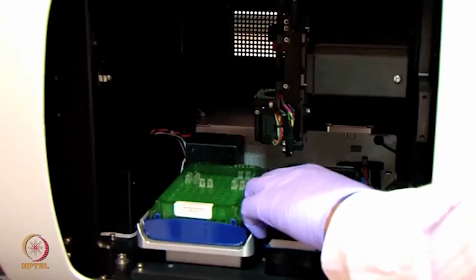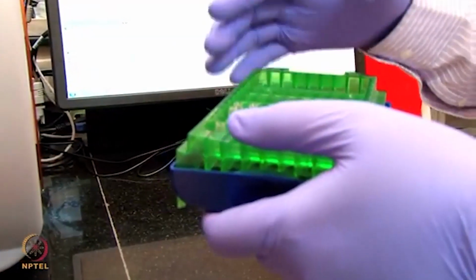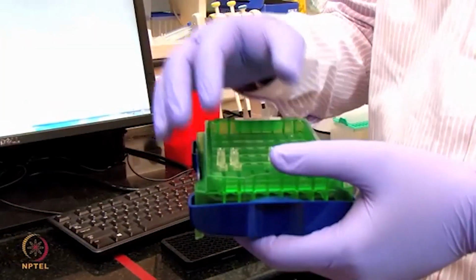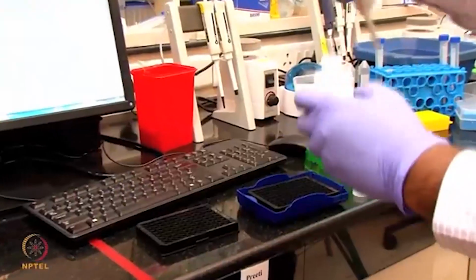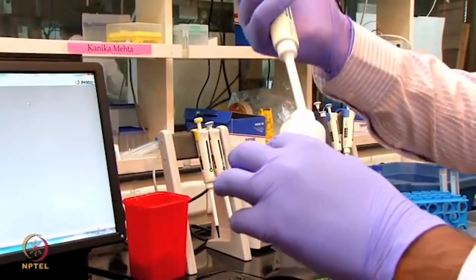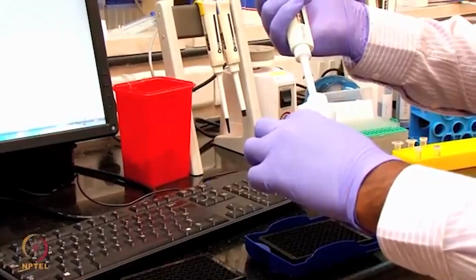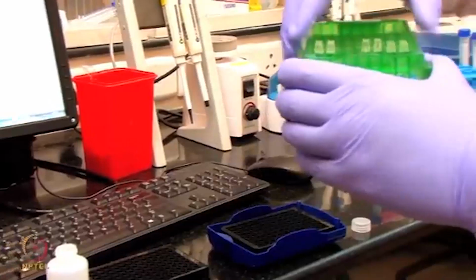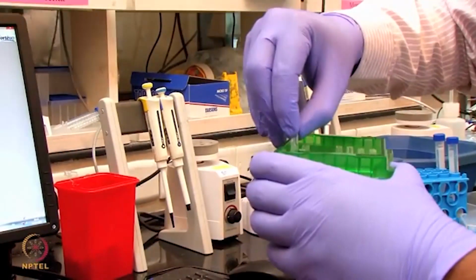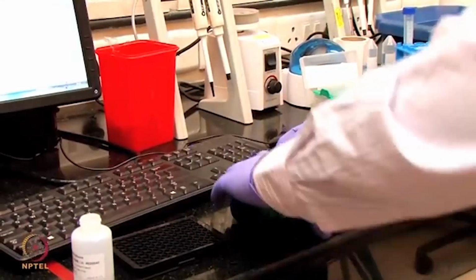Now I am going to take back this sample plate and also the sensor tray. This sensor, which is hydrated in the PBS buffer, and also our biotinylated antibody, are in the PBS buffer. Now I am going to equilibrate these sensors with the PBST buffer, the PBS buffer having Tween in it. We call this PBST buffer the sample diluent buffer. Here I am going to take 200 microliter of this PBST buffer and add it in A2 and B2. Now I am changing the sensor position from A1, B1 to A2, B2. So now I will start the equilibration of the sensor with this particular buffer.